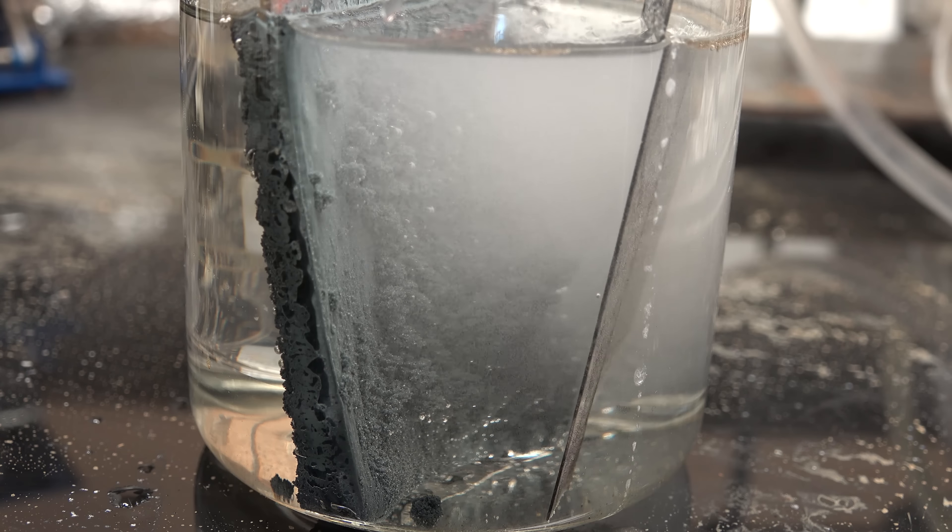Anyway, back to the zinc metal. It's a couple of hours later and the zinc has taken a tarnished appearance because it's reacted with the air to produce a layer of zinc oxide. This is only a surface discoloration and the zinc underneath is still fine. Now just scrape off the zinc. As you can see it's crumbling into a powder.